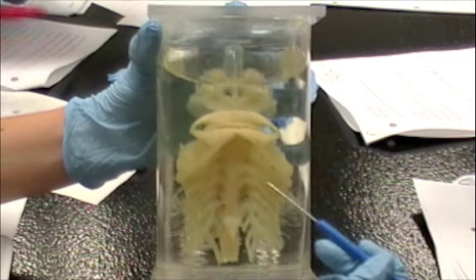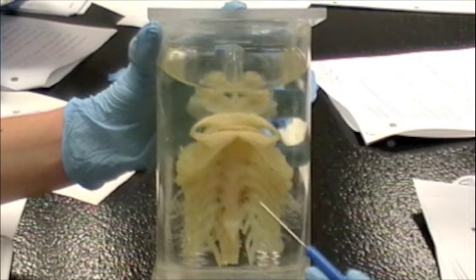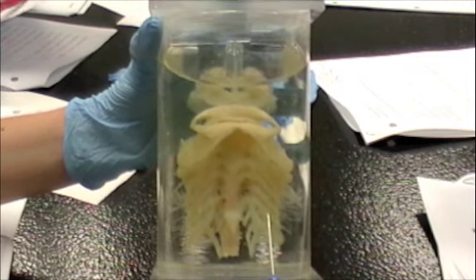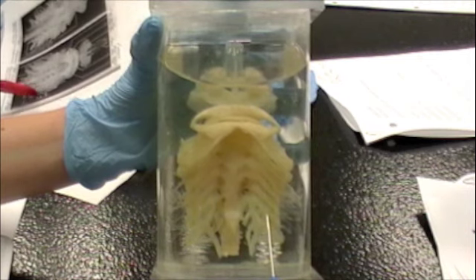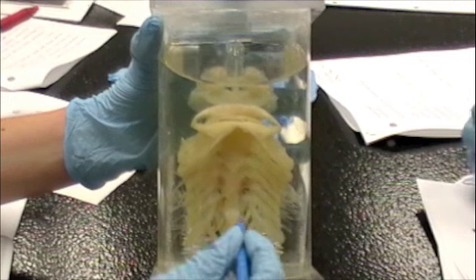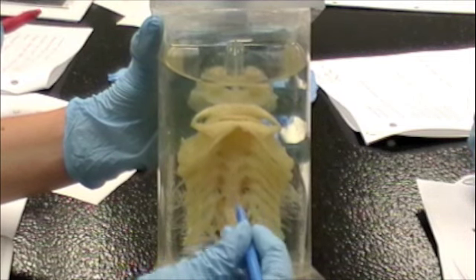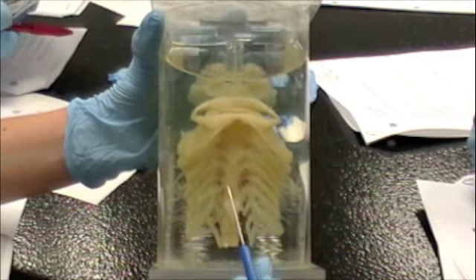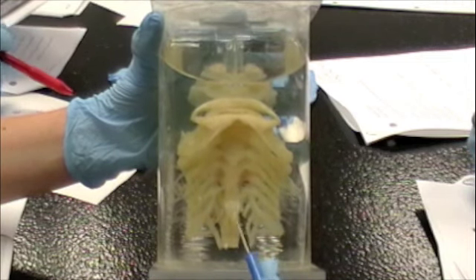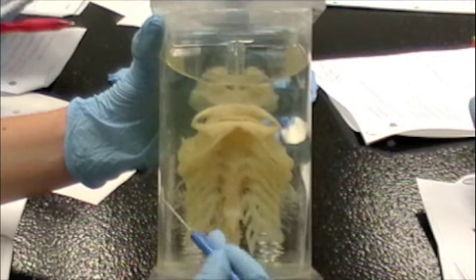Branchial arches down here — there are five of them. They're the thicker, more prominent arches. And then there's gill rakers, which are the thick things coming off of them. And then the spaghetti-like gill rays.